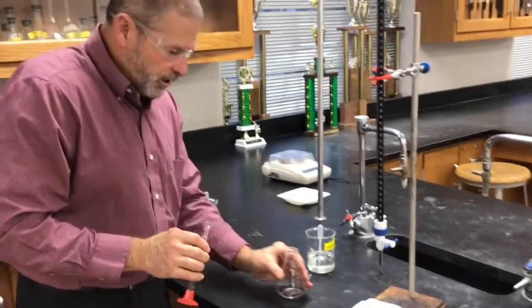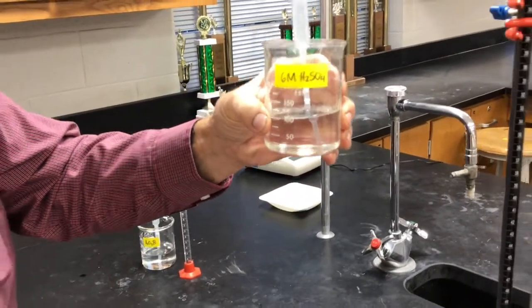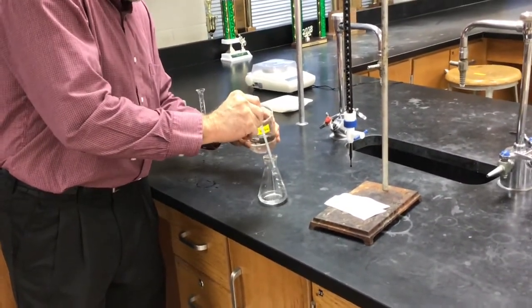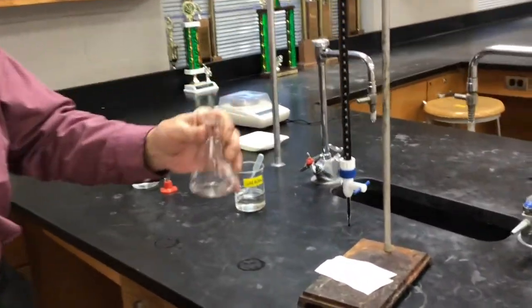Now, as you know, these aqueous redox reactions tend to occur either in acidic or basic solution. This one happens in an acidic solution, so we have to acidify it. So Mr. Moore made up some 6 molar sulfuric acid, and we're going to squirt in a couple nice healthy dropperfuls. So you're not measuring the sulfuric acid? Nope, we just have to make sure that we have a good excess of hydrogen ions present. If we didn't put that in, the reaction wouldn't happen. And it's really the hydrogen ions that count here. The sulfate ion is just a spectator. I would forget about it when trying to do the net ionic equation.